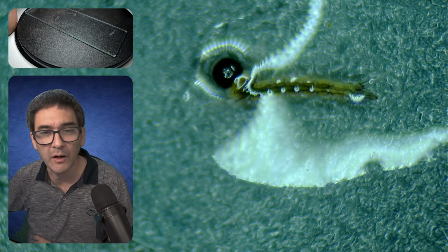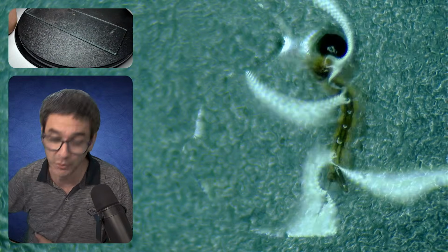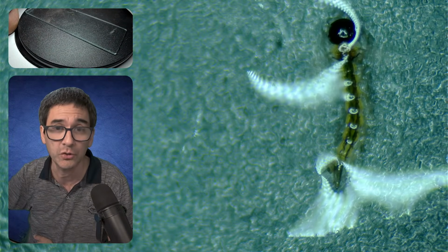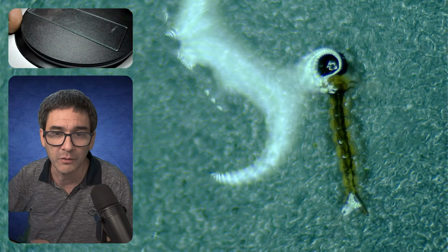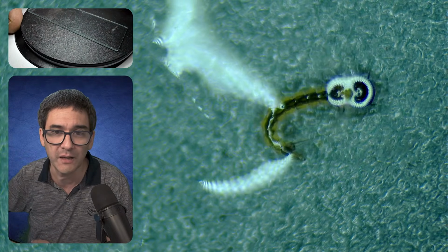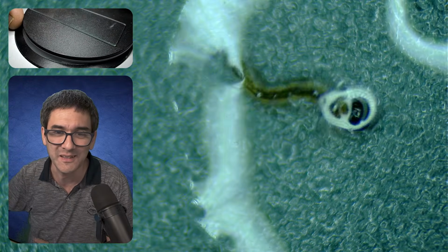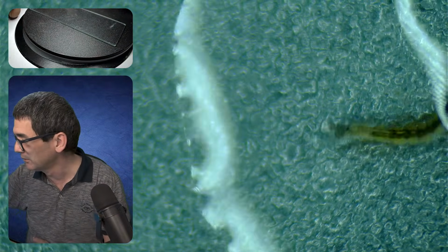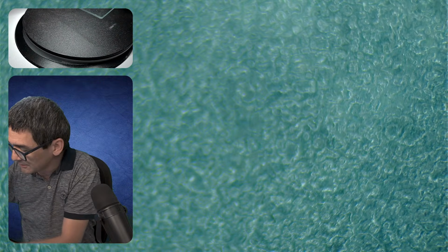So the question is now, how does this look under the microscope? As a matter of fact, what I'm going to do, I'm going to put it back into the tube, and then maybe after a couple of days, it's going to undergo metamorphosis, and then we're going to have the adult, and then I would like to also mount the adult insect as well. But let's have a look before we look at the algae. Let's have a look at this here. Just a second. Only low magnification possible now.